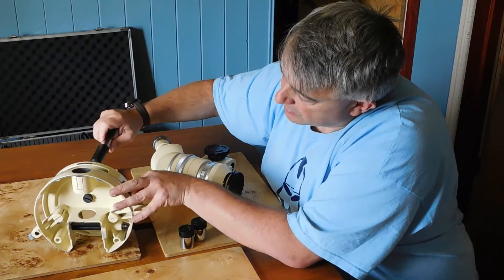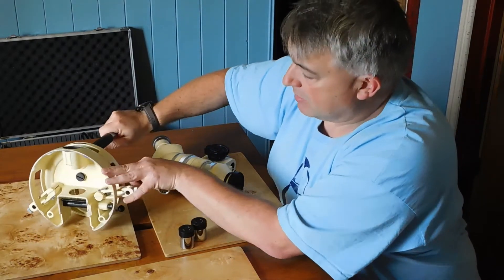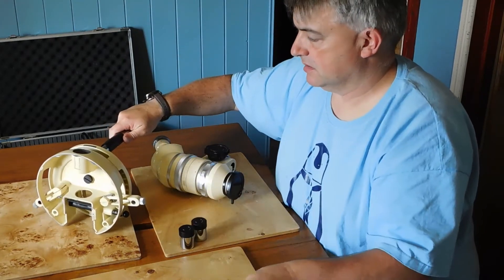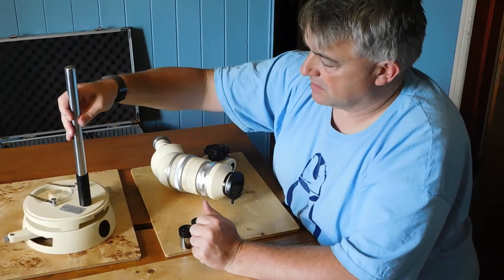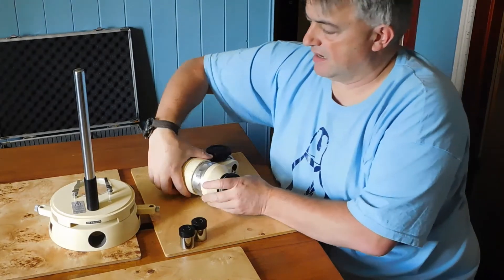The spanner stops the nut turning. I've actually now tightened the nut and don't need the spanner anymore. You can see that it is actually quite firm on the base, and that's going to support the main scope.